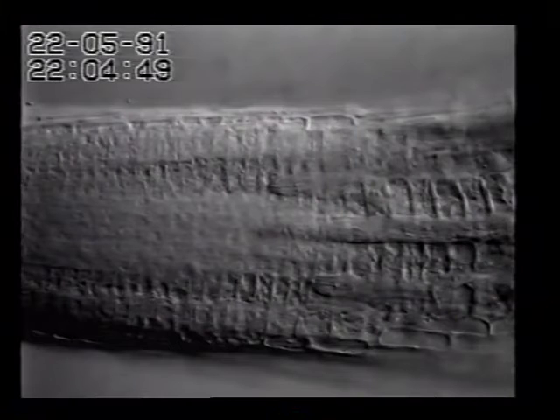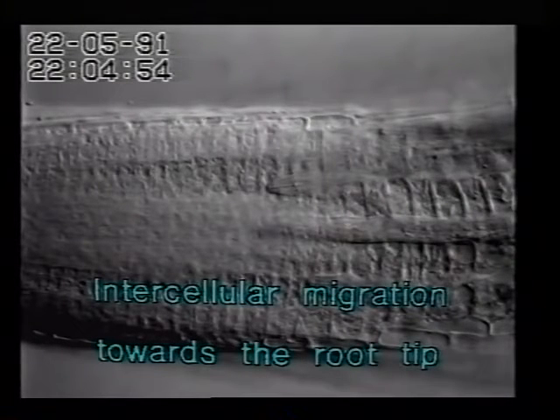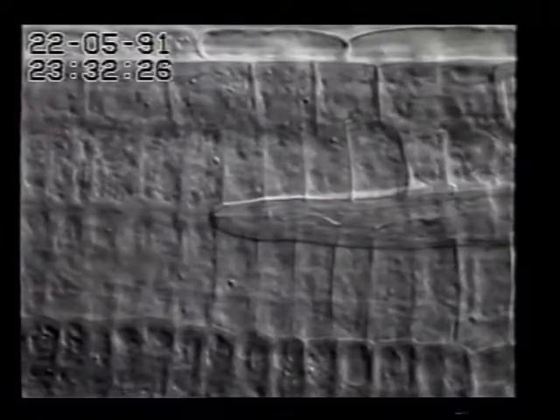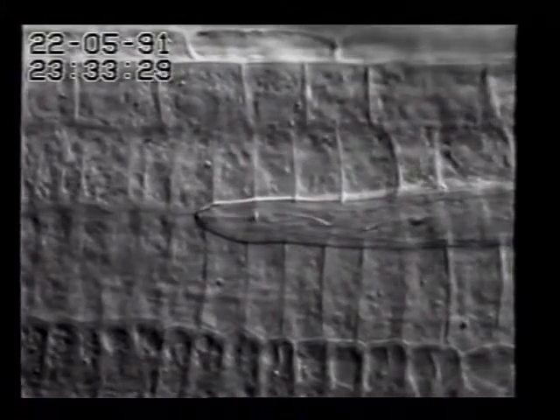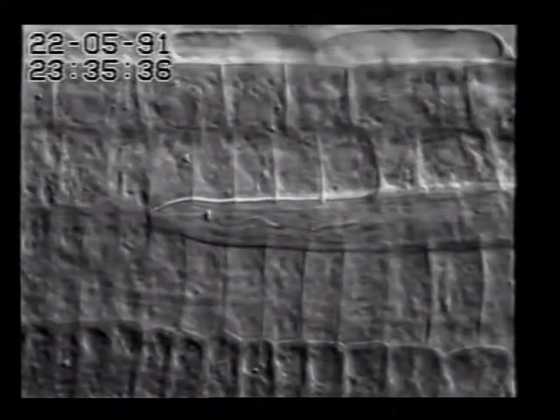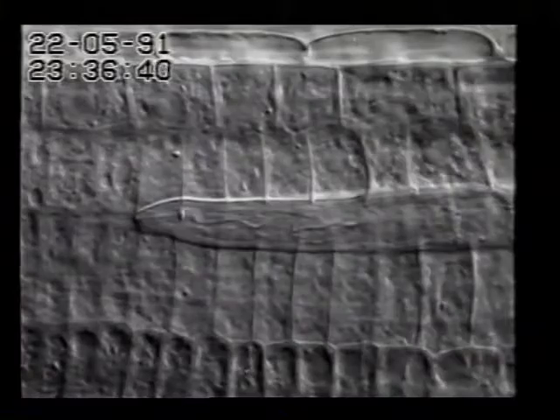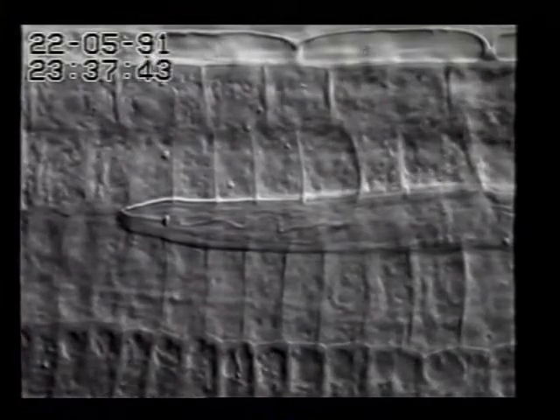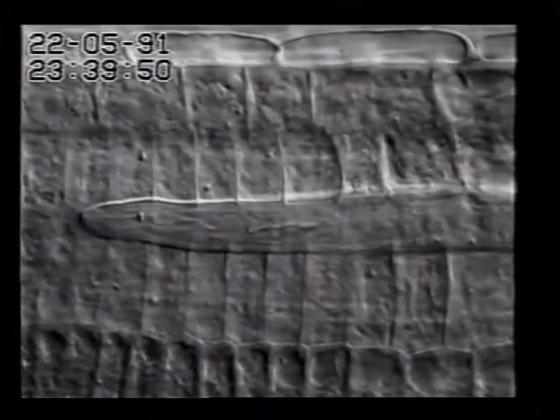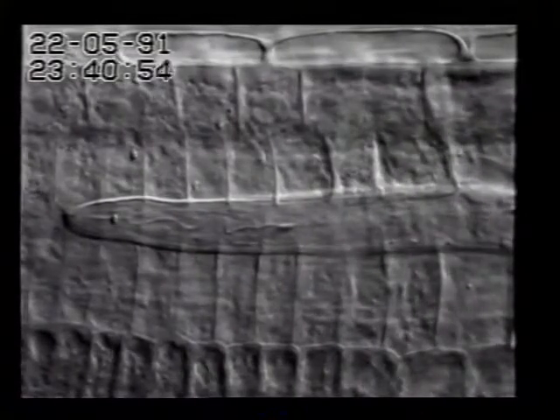The following scene now shows successful migration. Here are two juveniles migrating intercellularly towards the root tip. During migration, the plant cells are almost not affected by the nematode. Only the intercellular space is widened to provide enough space for forward movement. This time-lapse sequence shows that the speed of root elongation exceeds that of the forward migrating juvenile.